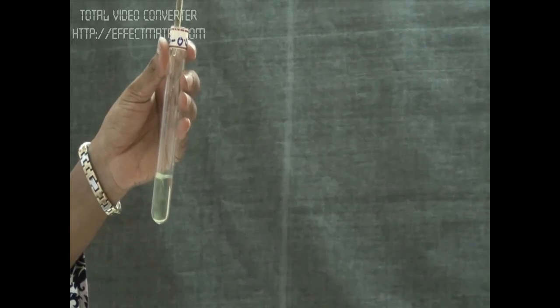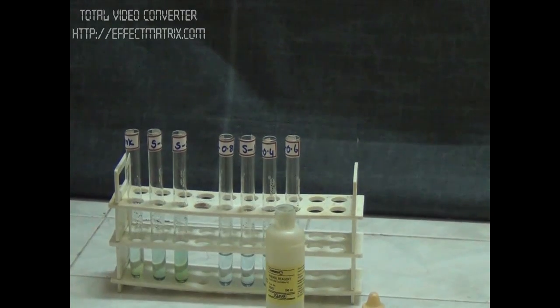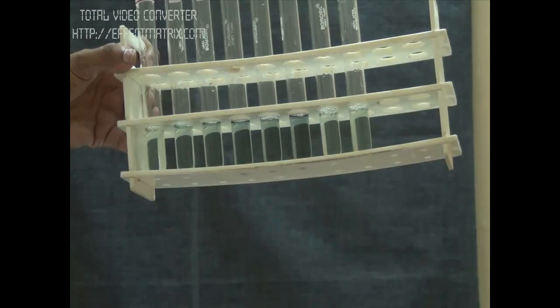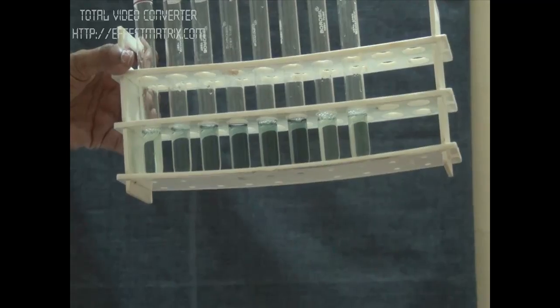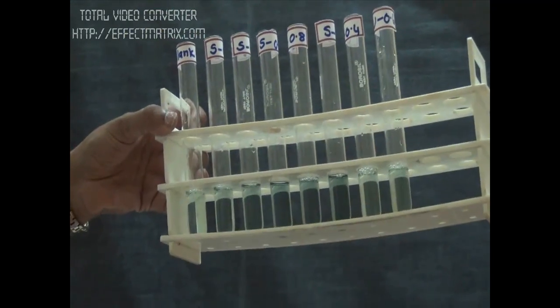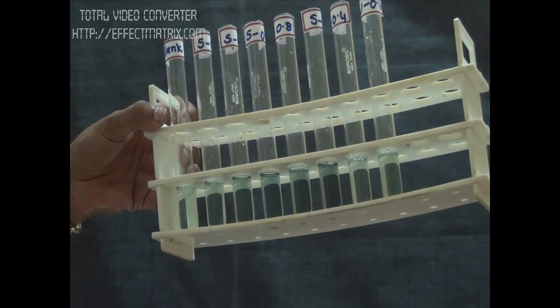After adding 0.5 ml to all the tubes, we will incubate for 30 minutes at 37 degrees Celsius.